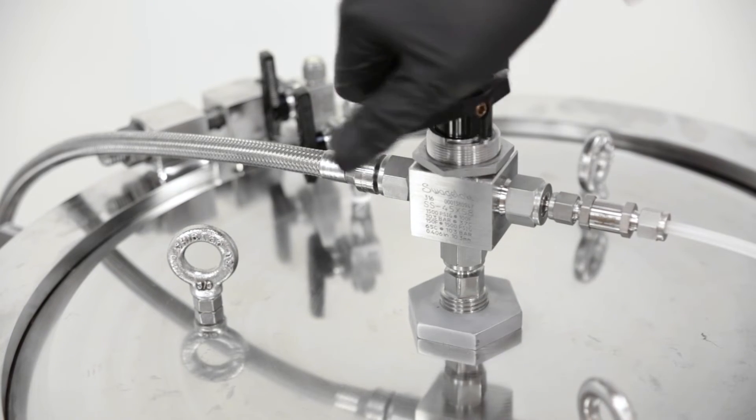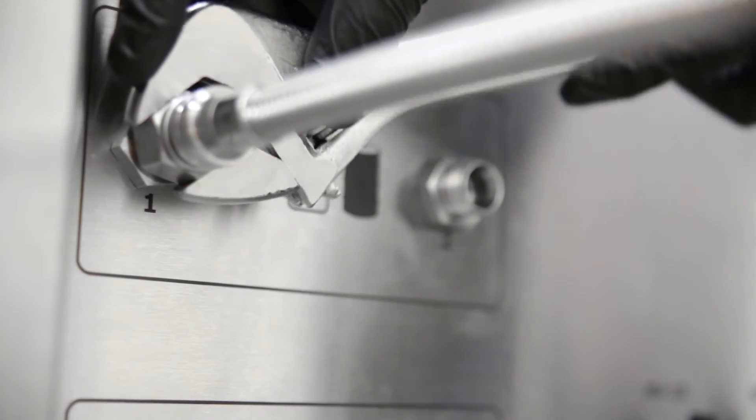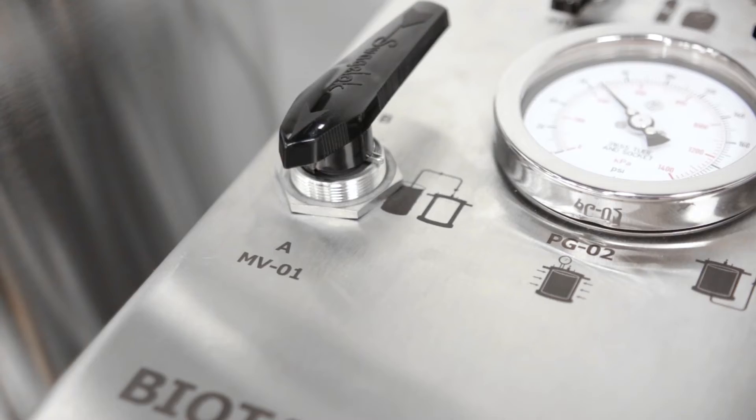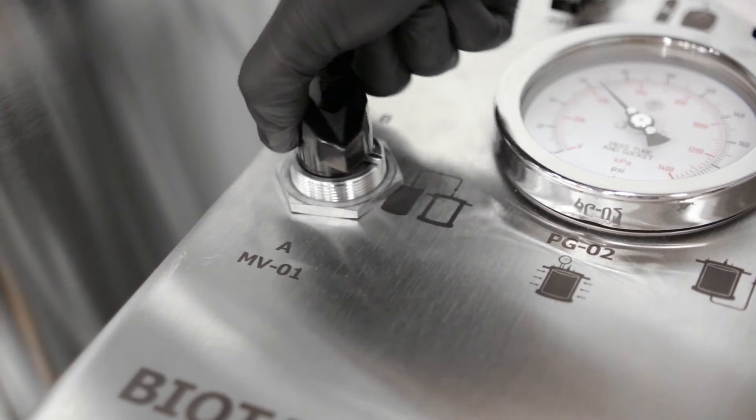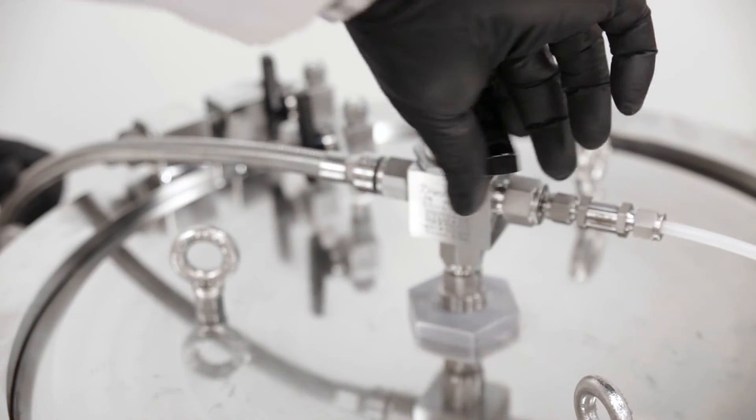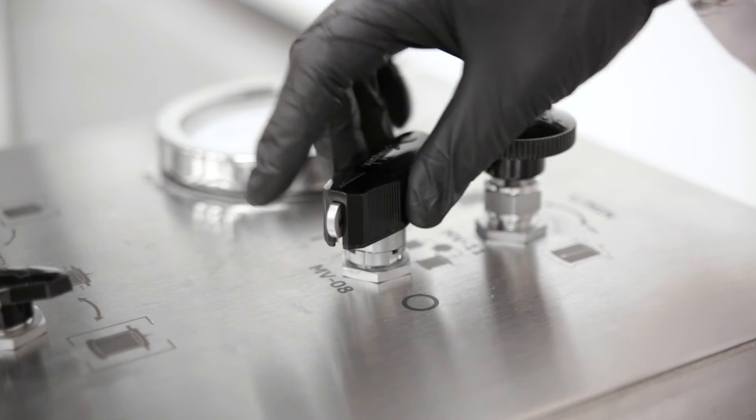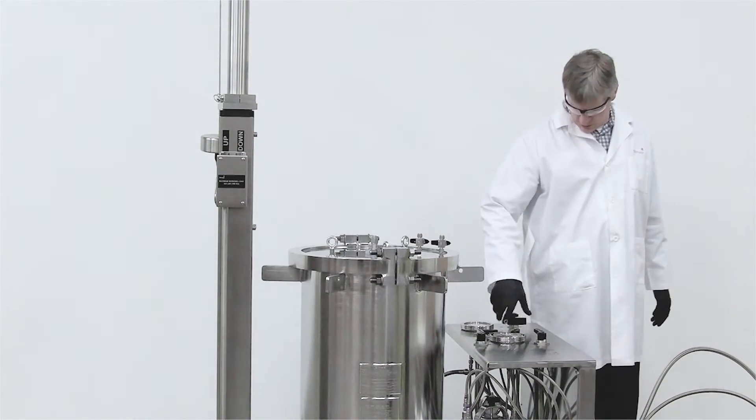Another option is to use one of the solvent inlet ports on the side panel. The active port is selected with the inlet valve. When the sample has been loaded, the three-way valve is turned towards the solvent line again.